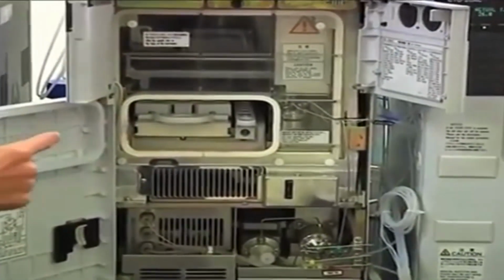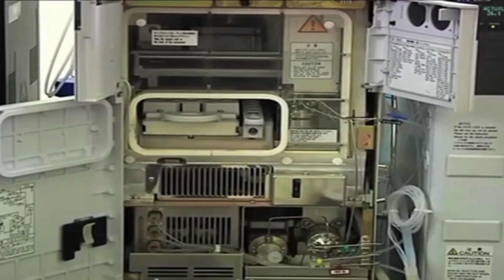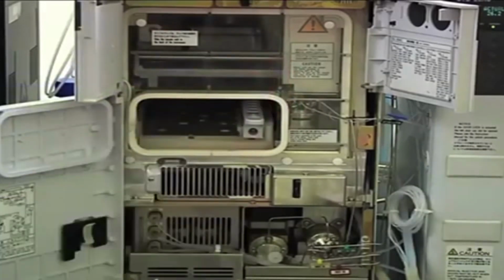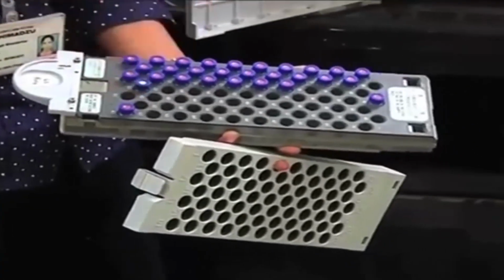Okay. Now the feature of this auto sampler is that it gives you very low carryover. What is carryover? It is almost near zero carryover. So what do you mean by carryover? Right. So you have to understand how injection happens. There is a needle, right? You will put your samples in this auto sampler in vials like this. You will fill in the vial, and the needle will come and pierce through this vial and take the sample.